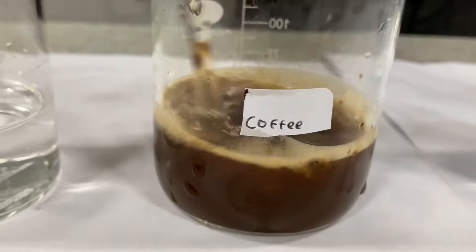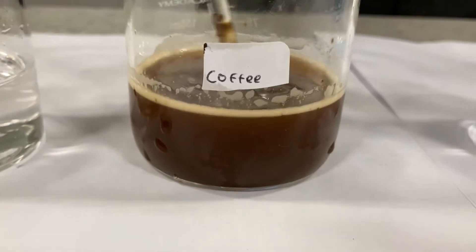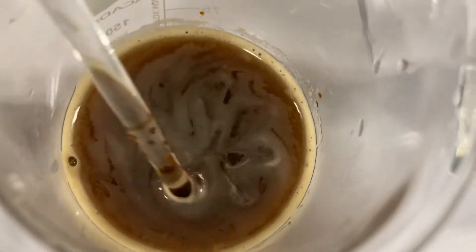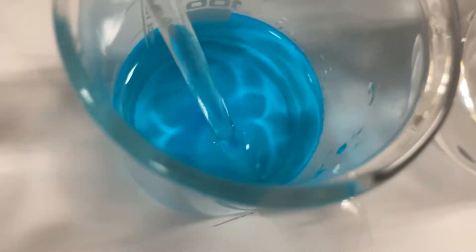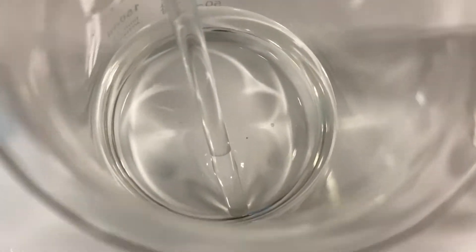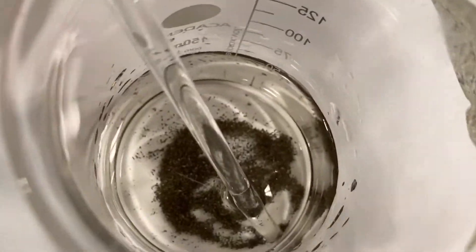Completely gone. This one here is the coffee — I can't feel anything on the bottom when I'm stirring it. It's not transparent but I think that is soluble, it has all gone. This one is salt — that's all gone, soluble. This one here is copper sulfate — nothing sitting at the bottom, that's all gone, that's soluble. Ammonium chloride — nothing there, it's all gone. And this one here is iron filings — just little bits of metal — and that's just sitting there at the bottom. That is not soluble.